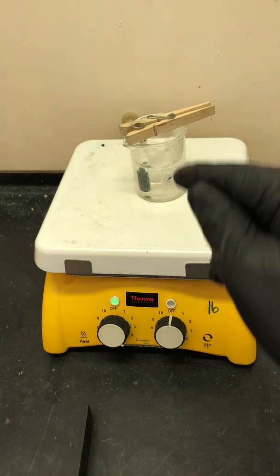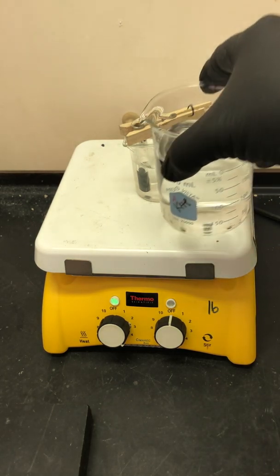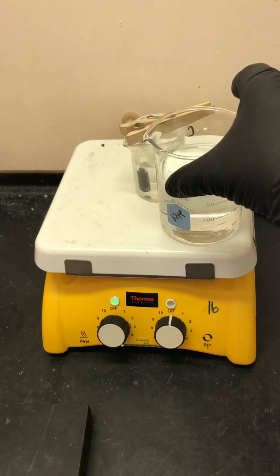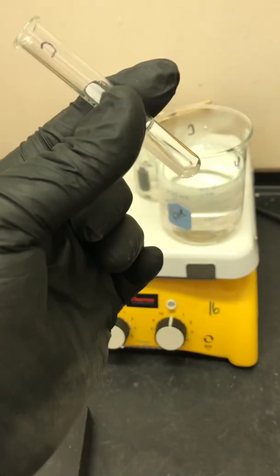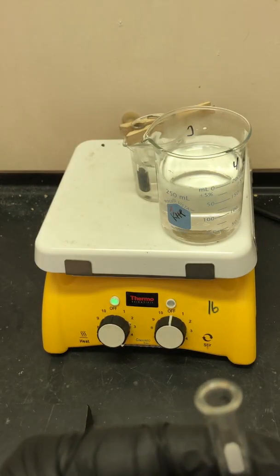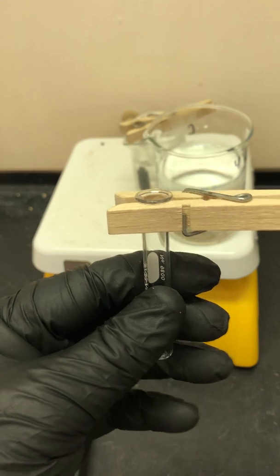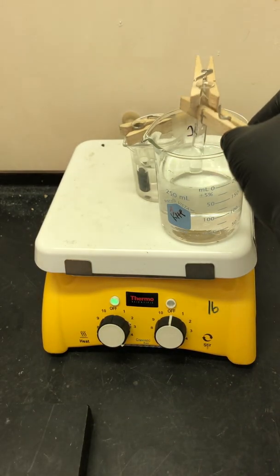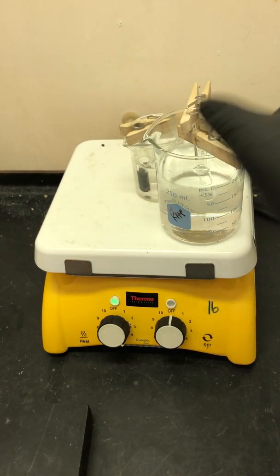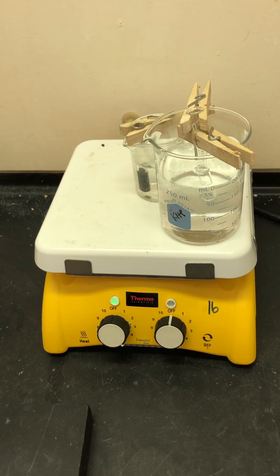Now, let's say your beaker was a bigger one. It would be hard to get the clothespin to span that distance. So what you can do is put two clothespins — one there and one there — so they span the distance across the top of the beaker, and you can put your test tube in there like that.